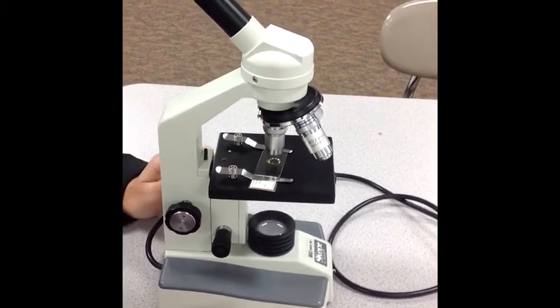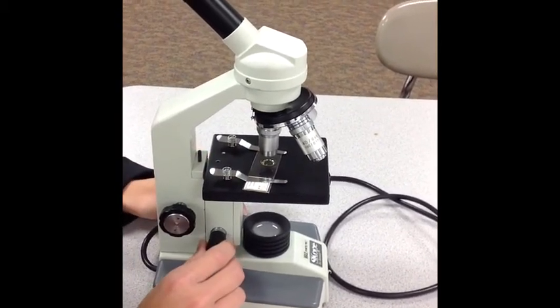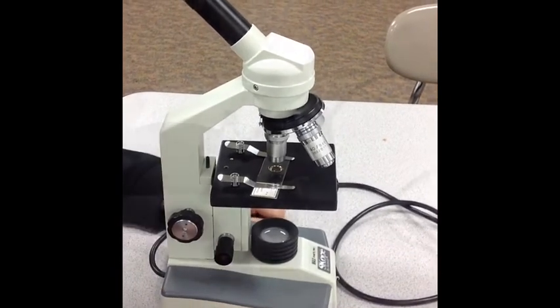Once you get it to where you can see it pretty good, use the fine adjustment knob to get a clear picture of the slide.